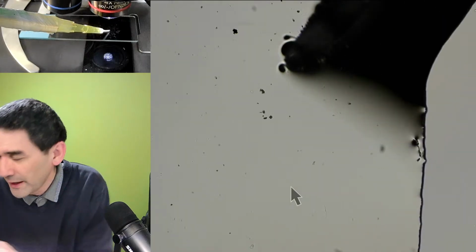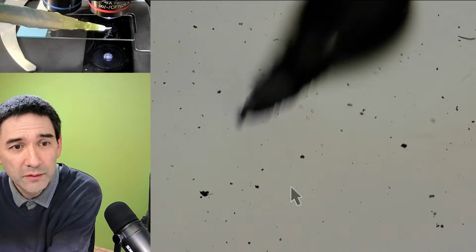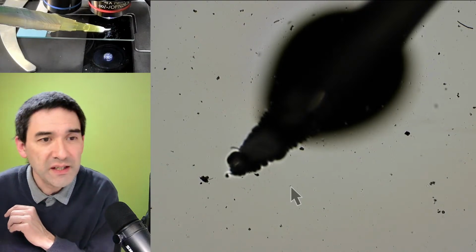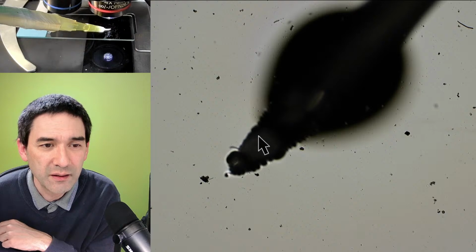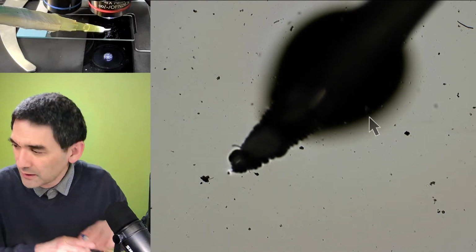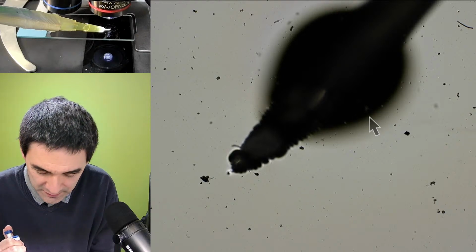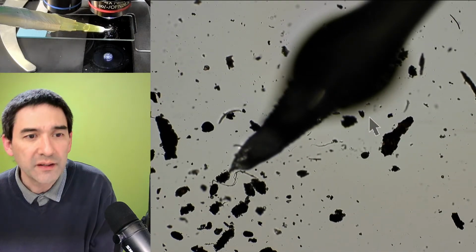Okay. So what we have over here is, let's move it in again a little bit more. Every time when you see something like this, this basically means it's not completely in water, so you have to add a little bit more water. I will do that, and I'm going to show you something that's better.